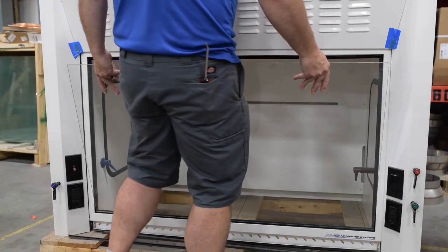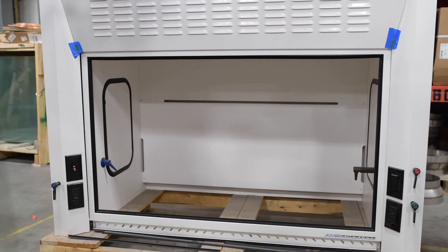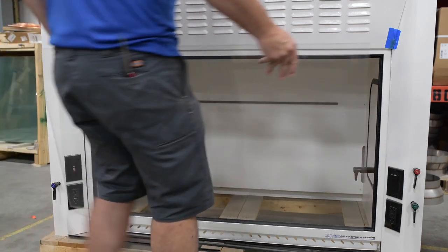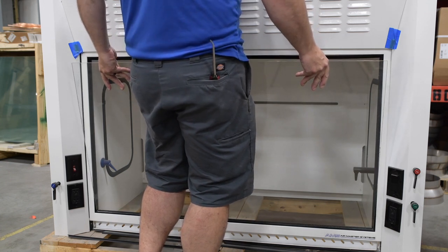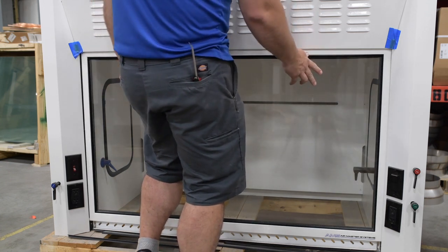With all of the front-facing trim removed, you can now remove the glass. The next step is to put your new piece of sash glass into position. Do this very gently and support it, as there is nothing to hold it into place.